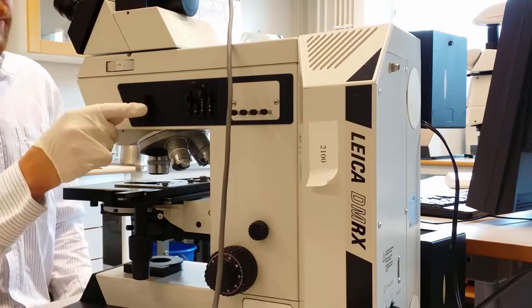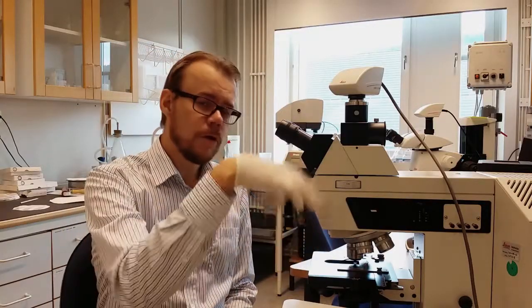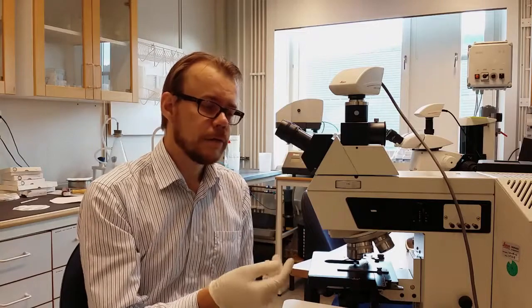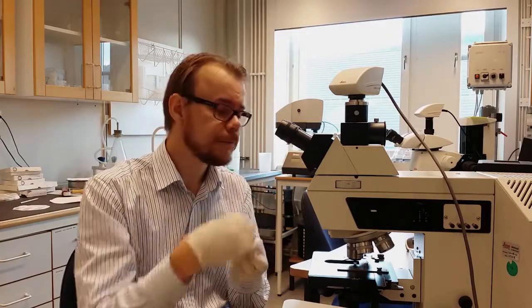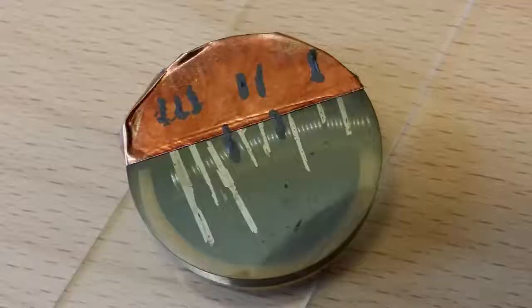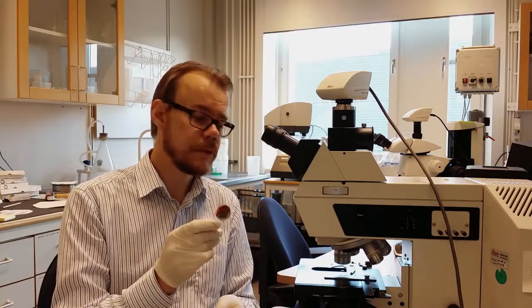What you can see here is that this microscope can both do top lighting and bottom lighting. So when you use the top lighting, you collect the reflective light of the surface. That is very useful if the sample, for example, is not transparent to light. Alright, let's put in the silicon sample now to demonstrate the dark field imaging.